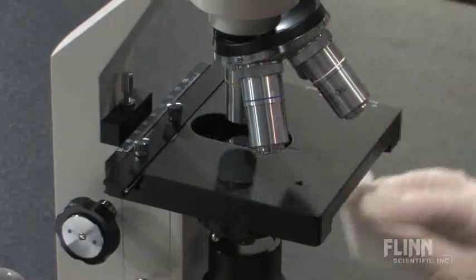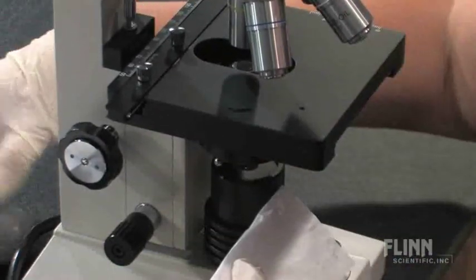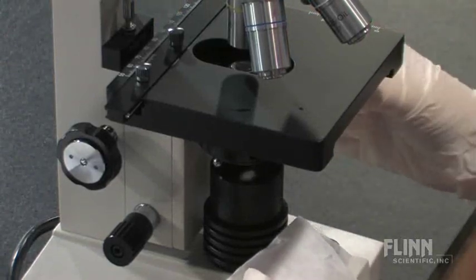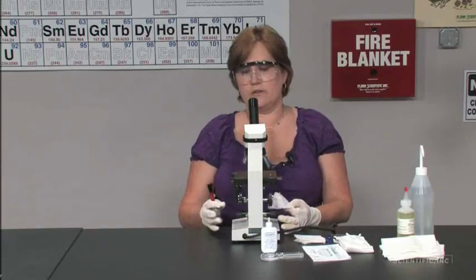With a light source, it's usually just dusty, so just either wipe or brush off the dust. By keeping the covers on the microscope while they're not in use.